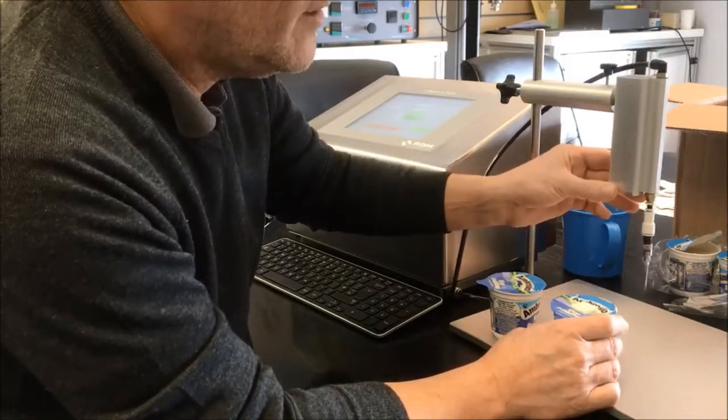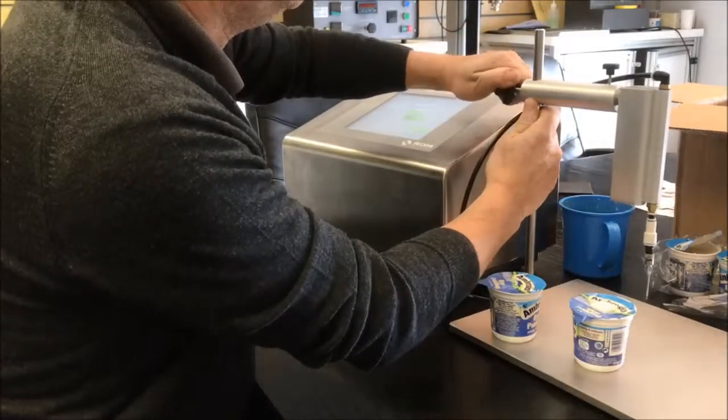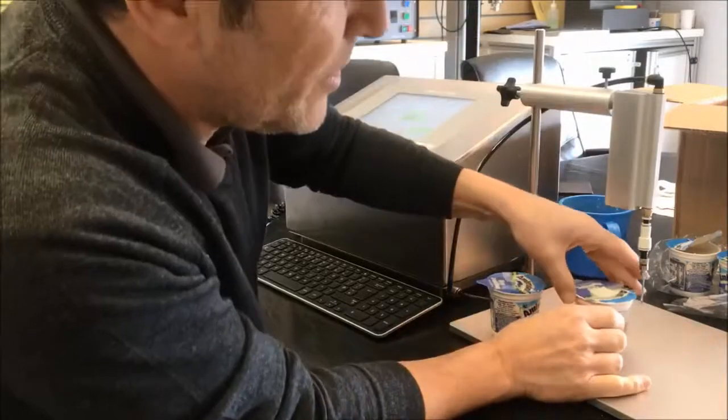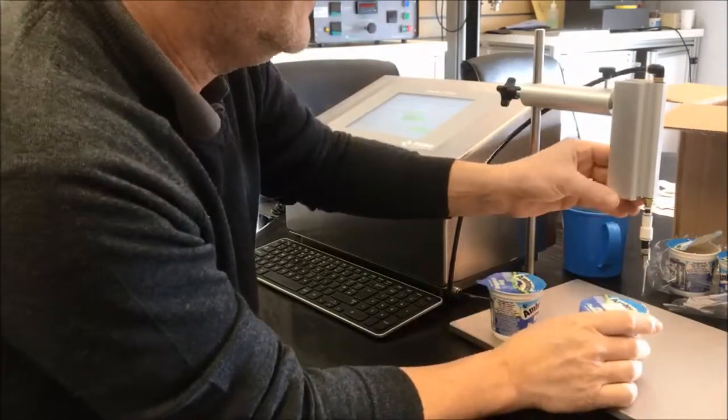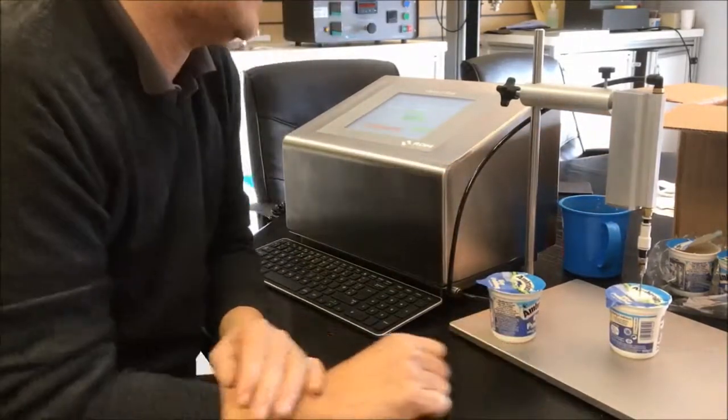The needle's on a little device like this which pops up and down. I'm just going to adjust this down a little bit. It just needs to come down to there so the top of the needle will go into the pack but not into the liquid inside it. We'll just pop that through like so and we're perfectly inside the pack now.